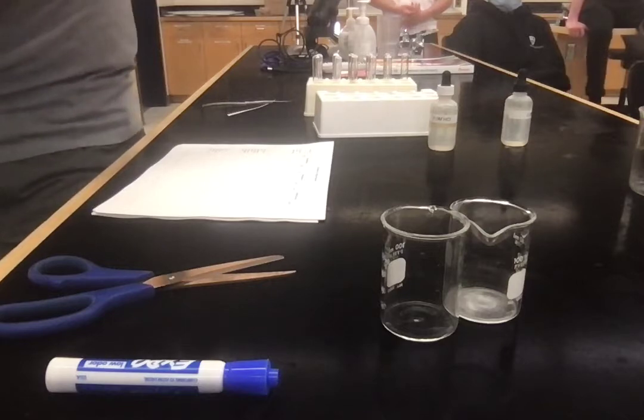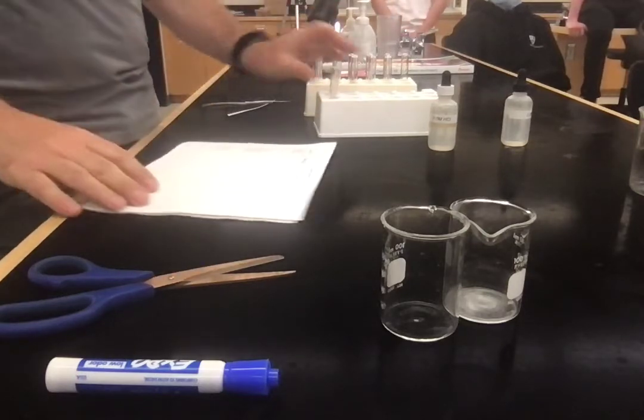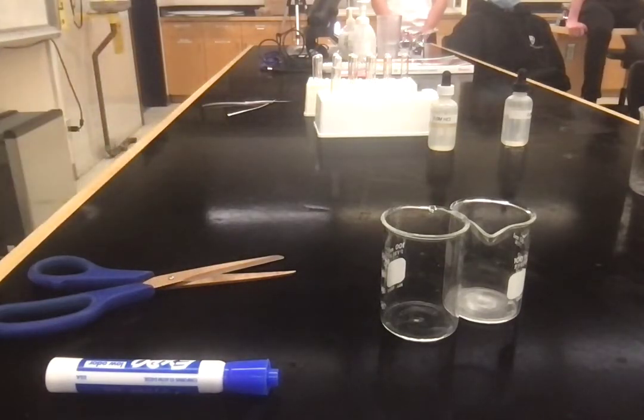Okay, so you're going to think about these. How could you potentially measure the rate of this reaction? Initially, use the back of this one. The rest of this is for the next three parts of the demo. Or shall I just do the first part? And then you can write that on the back at a later time.